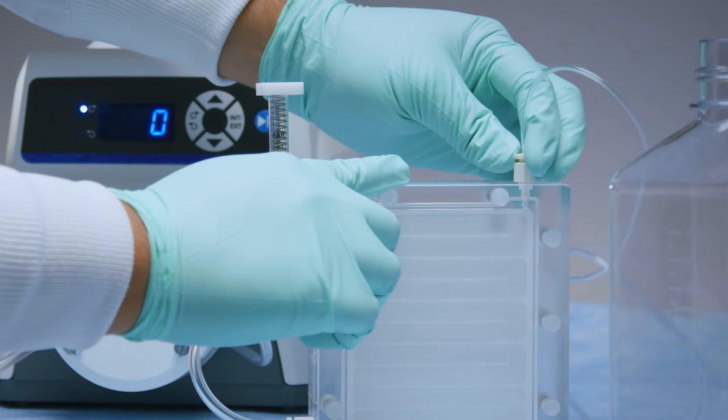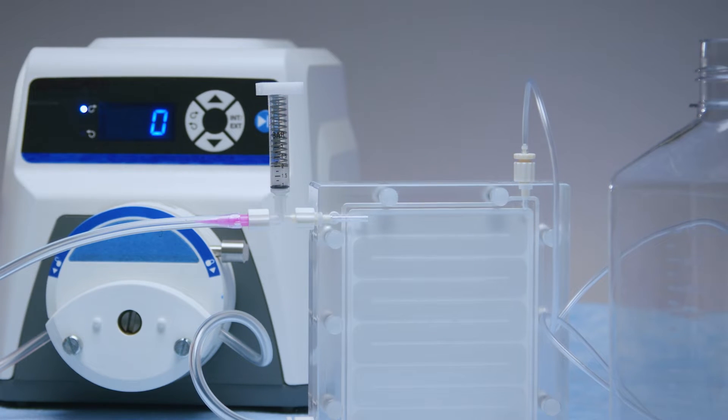Lastly, connect the filtrate line to the cassette and insert it into a filtrate reservoir.